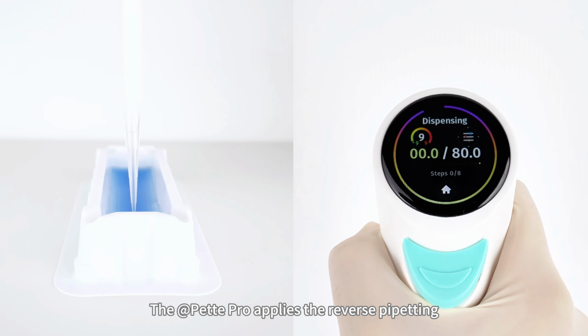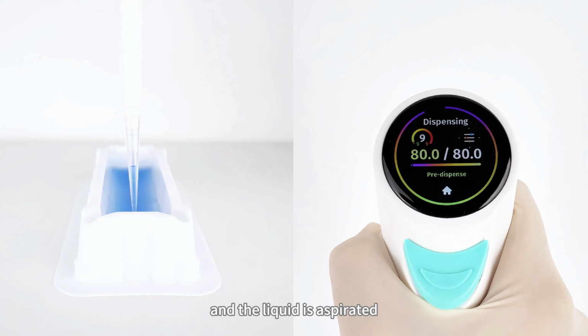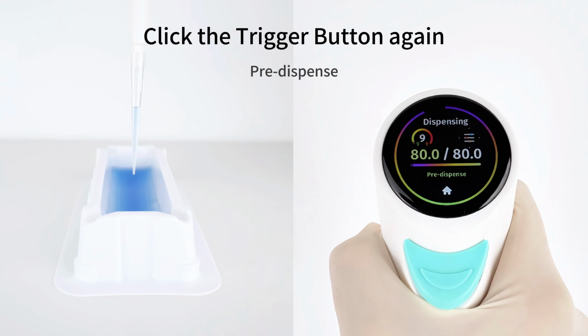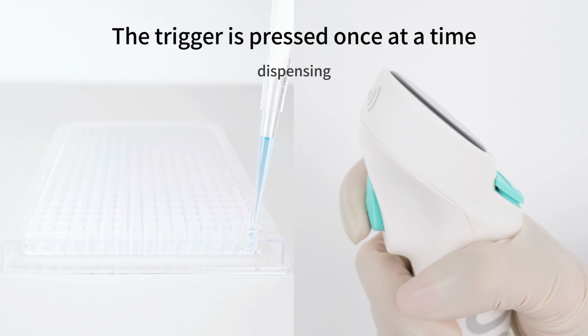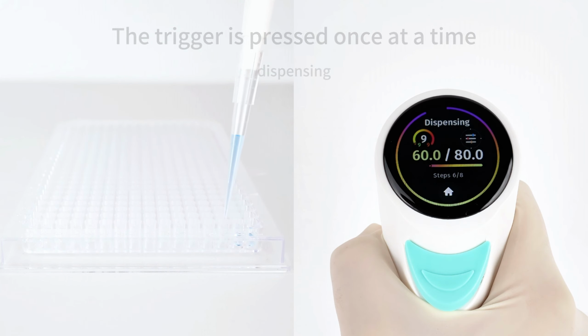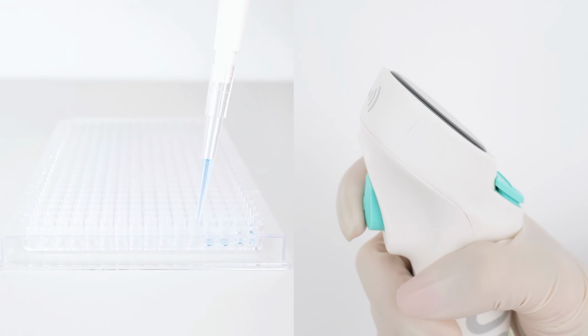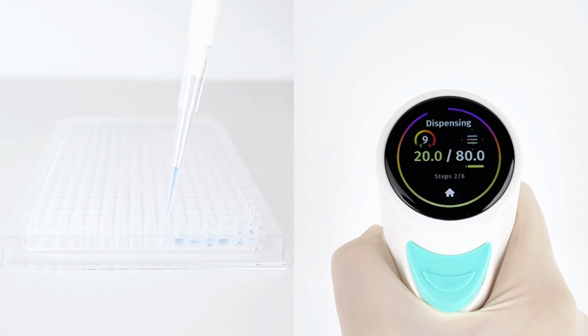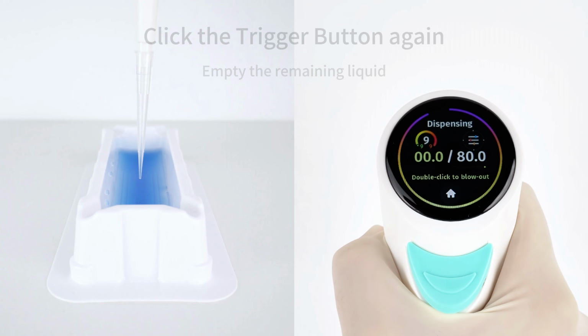The Pette Pro applies the reverse pipetting principle for more accurate dispensing each time. After the trigger is pressed and the liquid is aspirated, the first step is to pre-dispense the liquid. Dispensing is then initiated by clicking the trigger button once at a time until the process is complete. Finally, press the trigger again to empty the remaining liquid.